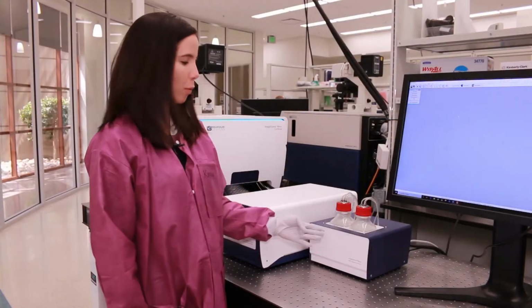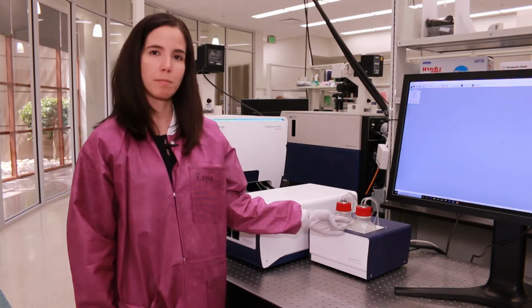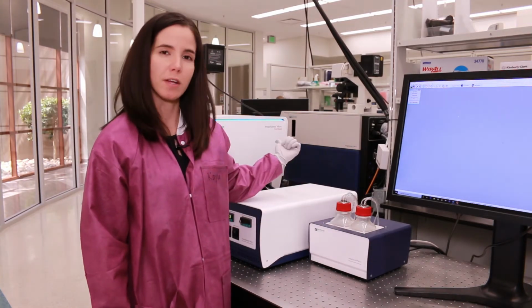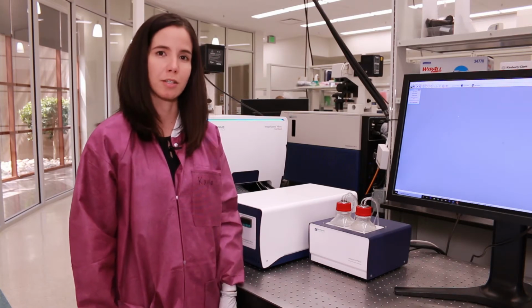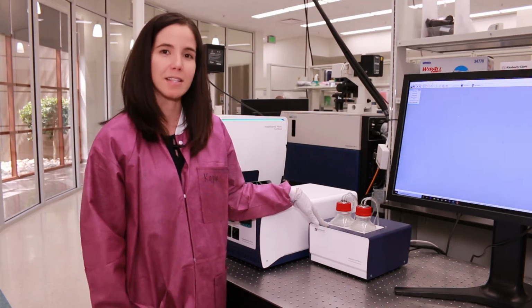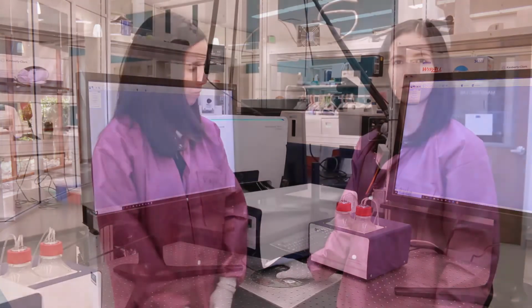Here we have our water immersion controller. This includes a source bottle for DI water, as well as a waste bottle. The tubing here connects to the interior of the instrument, where you saw the water immersion objective also connected to additional tubing. This system will dispense water to and from the objective safely and seamlessly. It acts no different than an air objective.